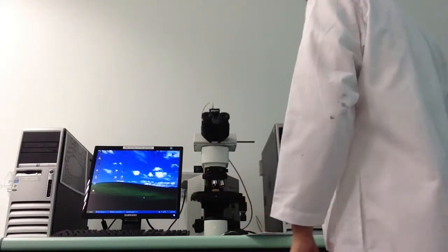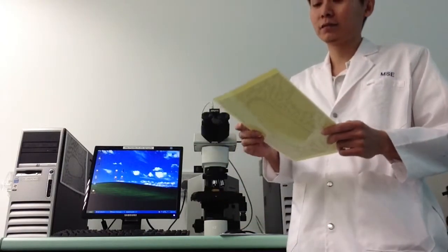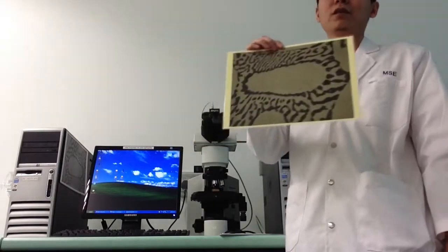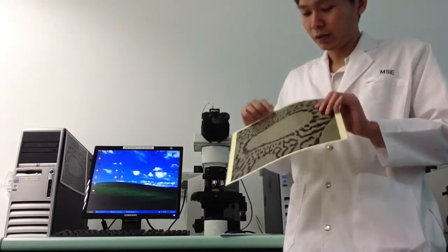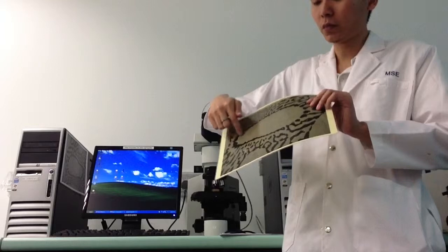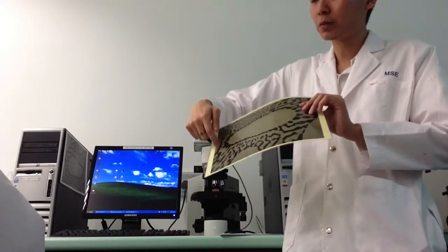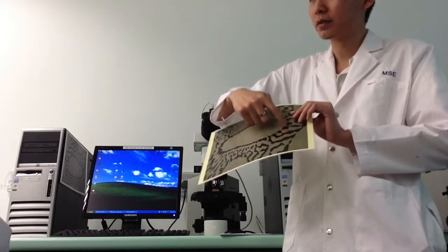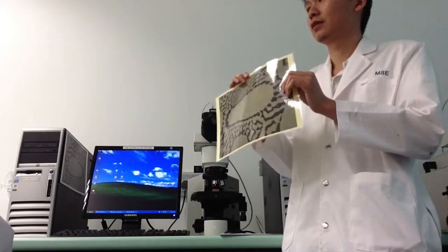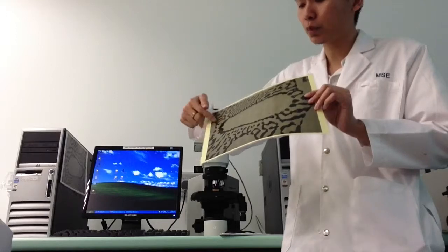So for the Lab 2, I only have one reference image. We are looking for something like this. This is the best case scenario. In the middle there's a pro-eutectic phase, which is the white area, surrounded by black strips, black regions. You have to look for something like this, and also try not to cut into other pro-eutectic phases.